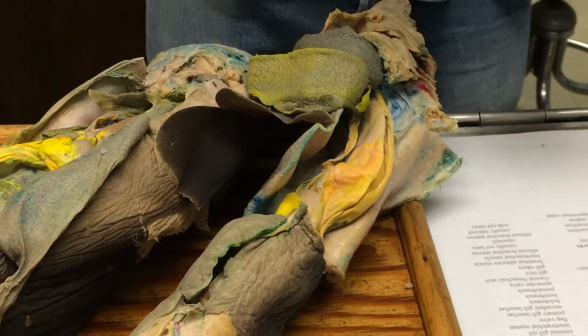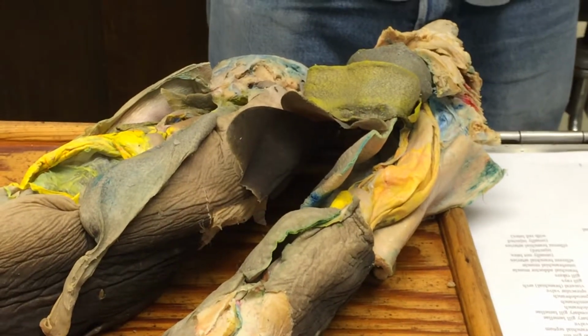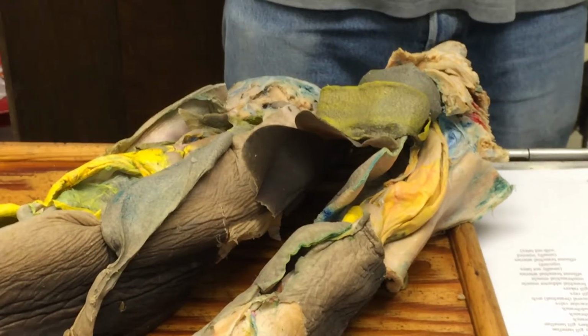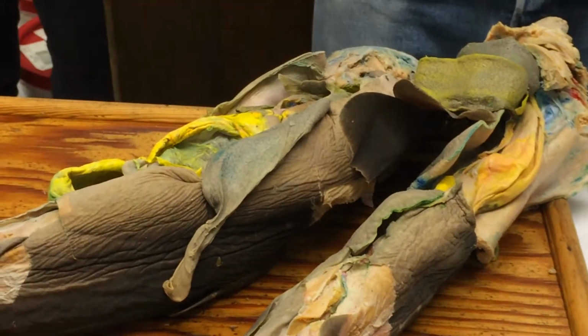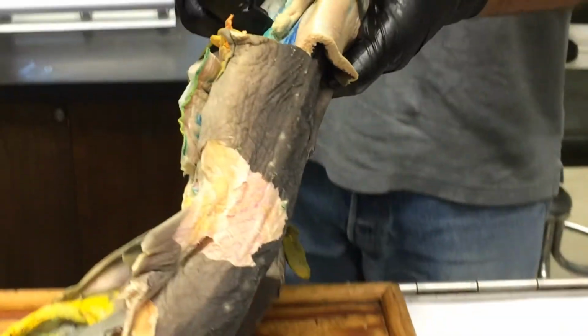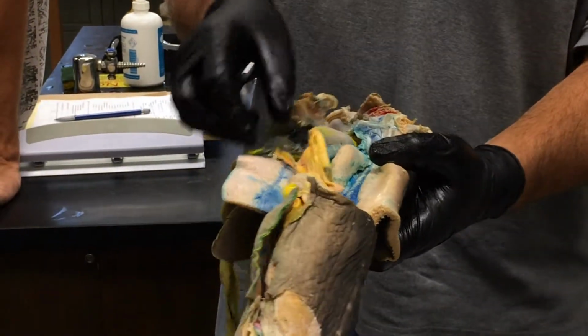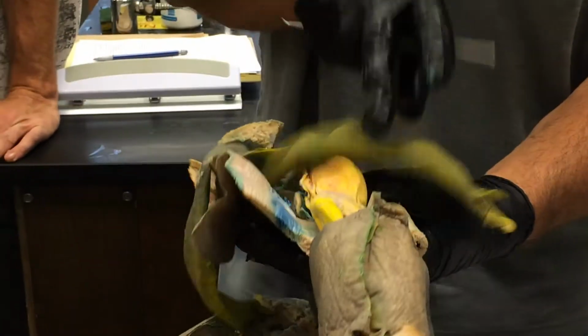Okay. Subsidiary mesenteries. So those are the real mesenteries, but then other organs can sometimes pouch out into the abdominal cavity and have a mesentery associated with them when they do that. So, for example, the testis has, oops, that one has no mesentery. Let's try the other side and see if that works better. Excuse me.